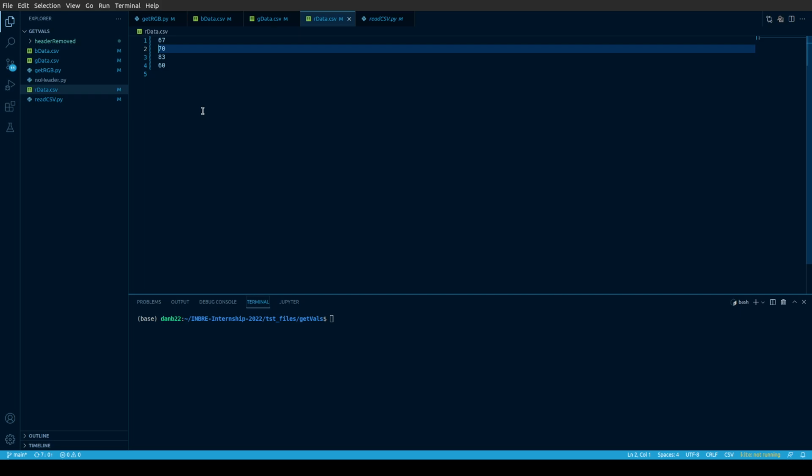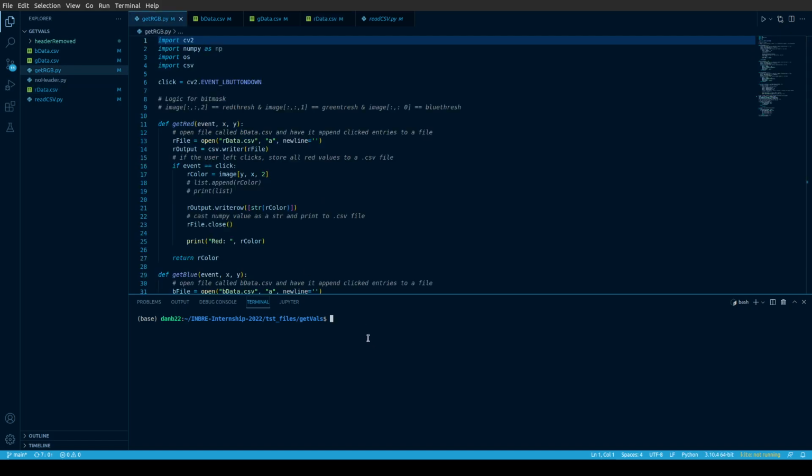So let me give you a quick run through of this. We're going to go ahead and run this program with python3 getrgb.py, and that's going to pop up another window. So I'm going to take a quick peek at that. This window is the one that's being generated right now, and it is of our zebrafish image. You can see down in the bottom left-hand corner here, we have RGB values and coordinates on the X and Y axis, which is pretty awesome.